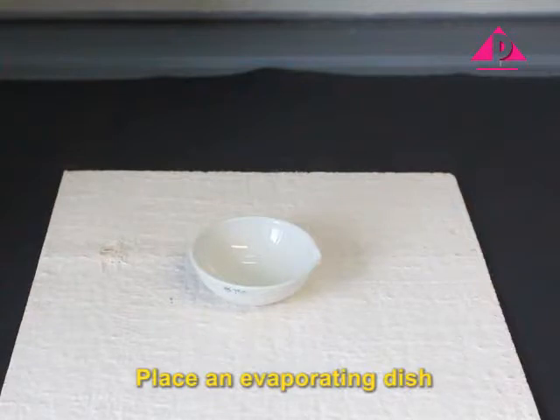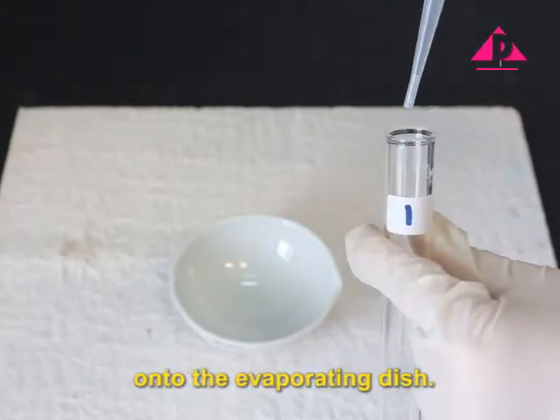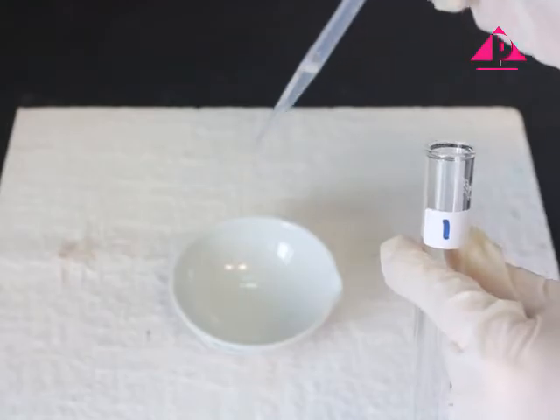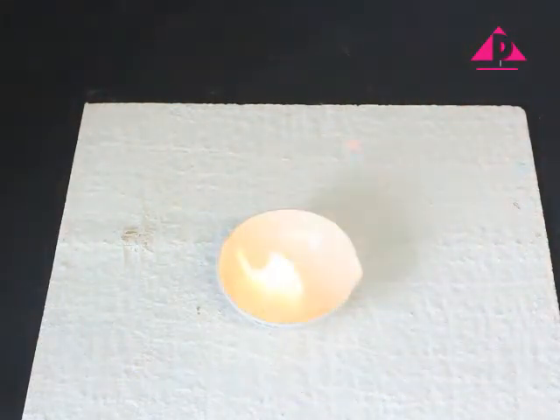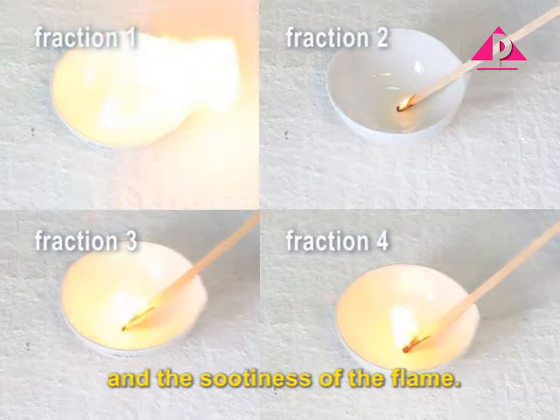Place an evaporating dish on a heat-resistant mat in the fume cupboard. Add 5 drops of petroleum fraction onto the evaporating dish. Ignite the fraction with a burning splint. See how easily it ignites. Observe the colour and the sootiness of the flame.